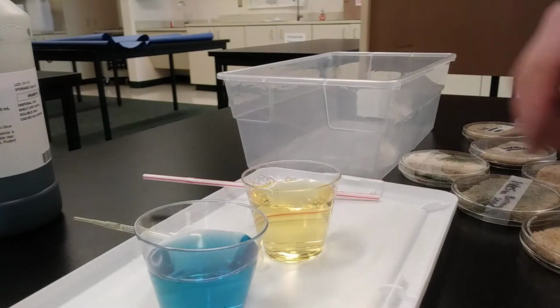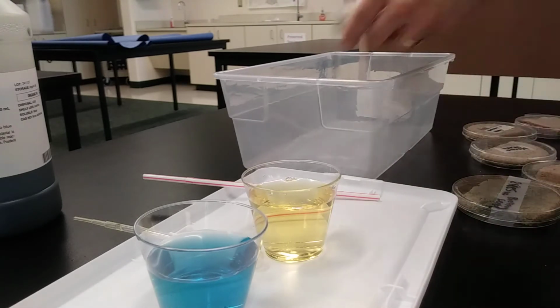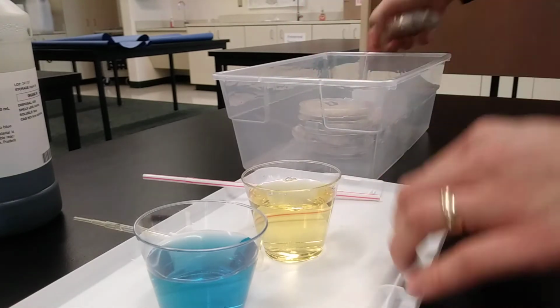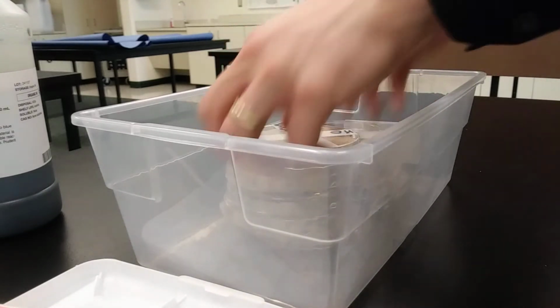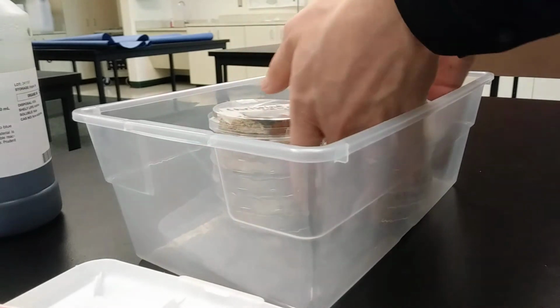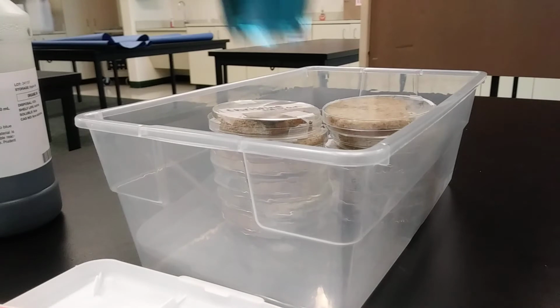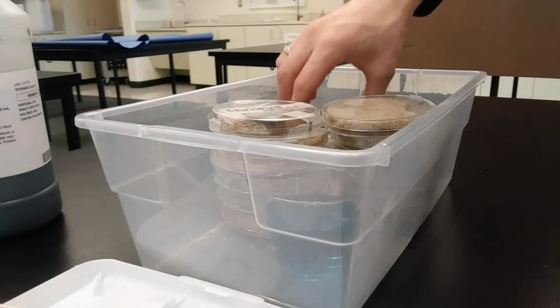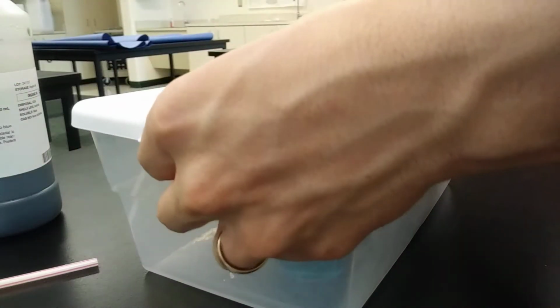So what we're going to do is put both of these into our box with our fungi. So I'm going to take our fungi and put them into our box here. Hope we fit them all, just barely. Offset them a little bit. All right. So now that those are all nice and snug in there, I'm going to take my basic, blue BTB, set it in, and I'll take my acid, my yellow BTB, set it in, and I'm going to go ahead and just kind of cap that up.